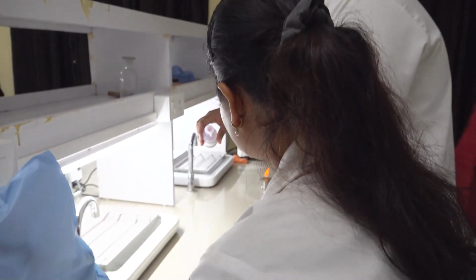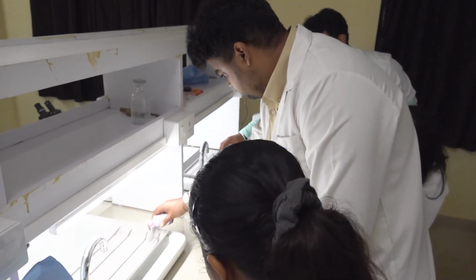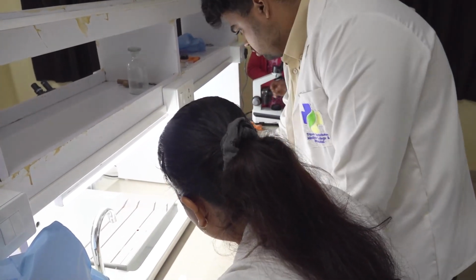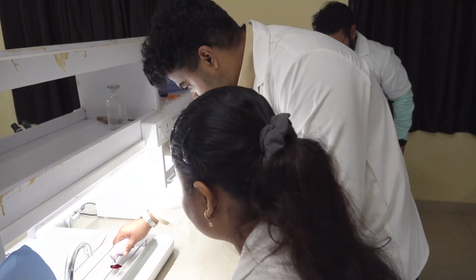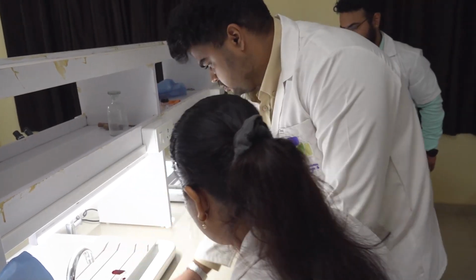पहले time देख लो. ओके, थोड़ा बीच में करो, थोड़ा बीच में करो. Do it on the center one. इसमें करो, इसमें करो, ऊपर सेंटर वाले में करो. हाँ, because you need to heat ना, so you need space. बस बस हो गया, उसको दे दो.